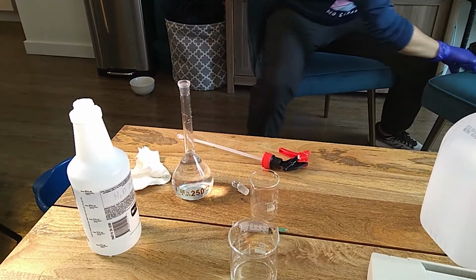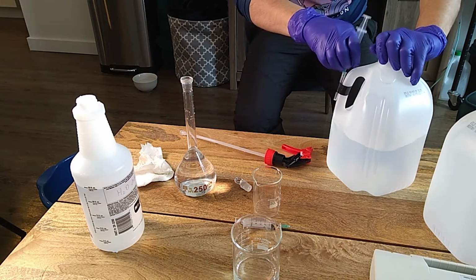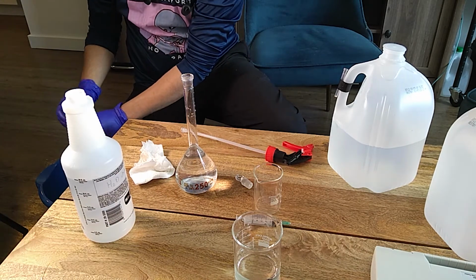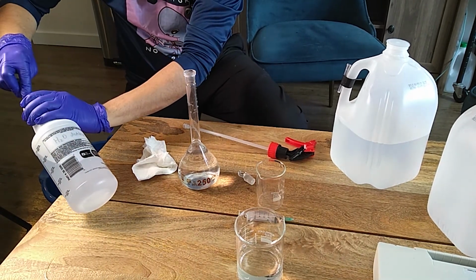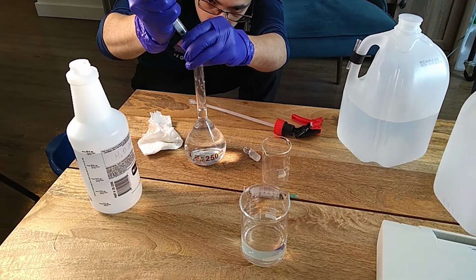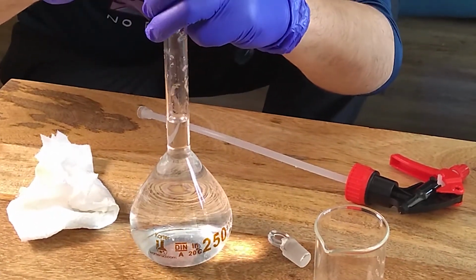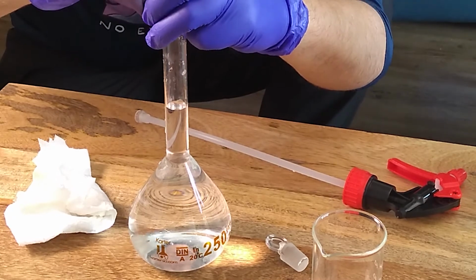And for the last bit of volume, I am going to be using a syringe as well, to get some distilled water. The syringe that I have, that I use exclusively for this distilled water. So I'm just gonna... always the last bit of the volumetric flask is hard to accurately do, so you want to make sure you're adding the volume very slowly. And that's it.